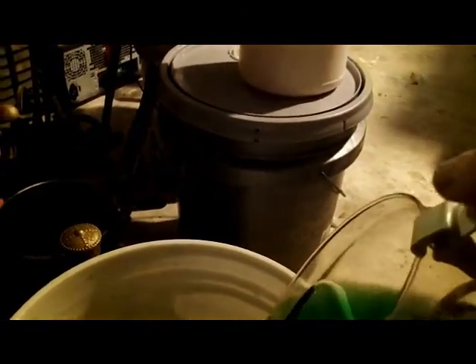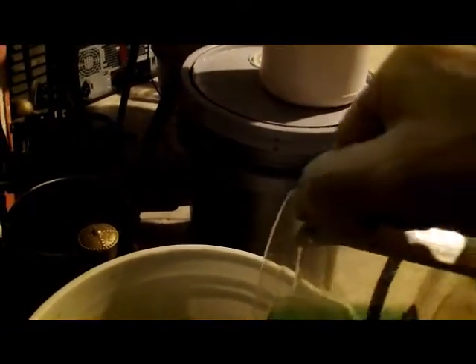Again, it's a hazardous waste — you can't dispose of it. But what you can do is not have to buy any more hydrochloric acid or make any more of this stuff; you just keep reusing it. I'm also noticing some sediment in here — there's some solid sediment down in there.